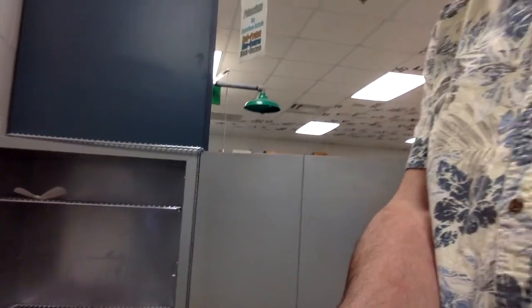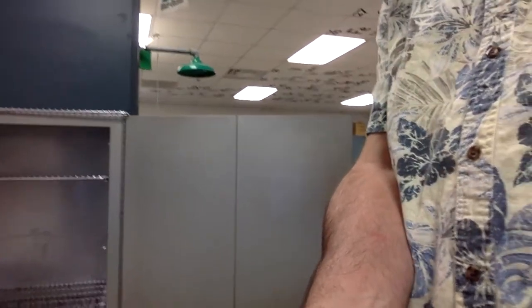Hello again. I'm on to day 2 of the lipids portion of our Carbs and Lipids lab. And on this day, we are going to get our final measurements that we're going to need in order to calculate the percent fat or lipids in the 3 different kinds of snack food. So just wanted to come back here and show you what things look like here in my oven.